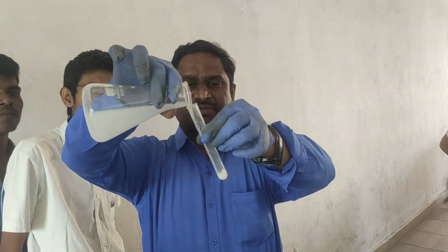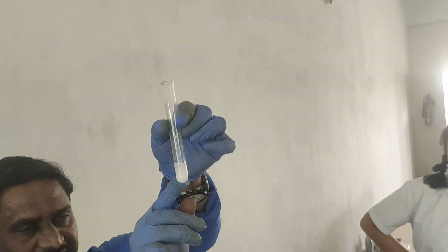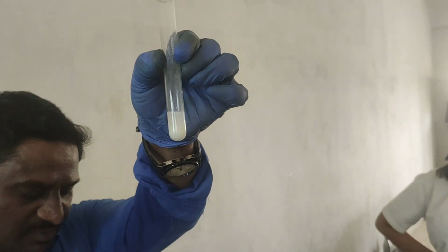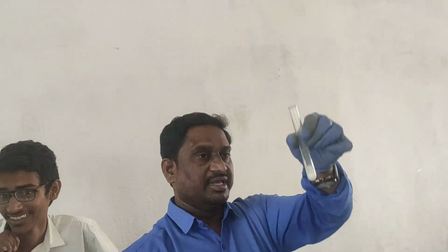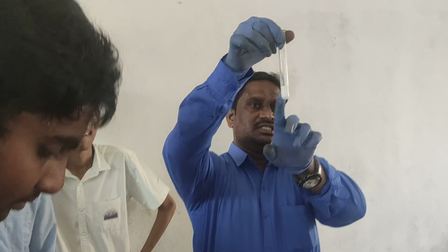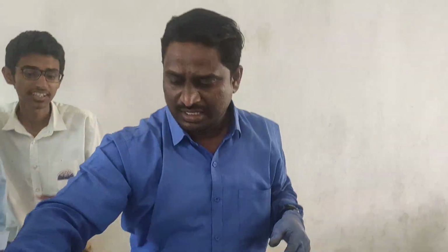What will you get? White precipitate. See, look at here. So this is the white precipitate. You can observe here the precipitate settles down. So what is this precipitate, children? BaCO3. So this is the confirmation test for carbonate.